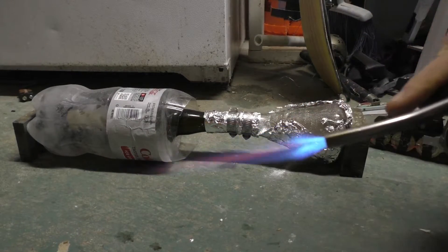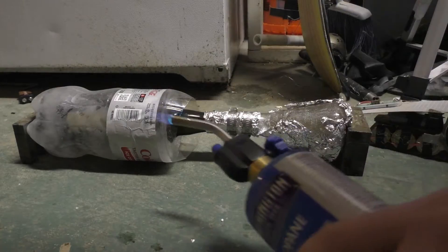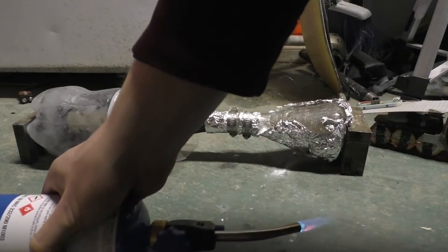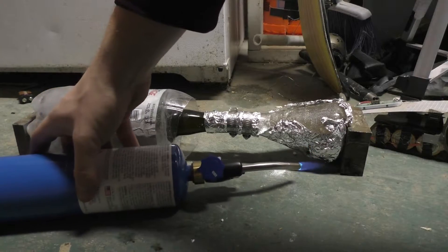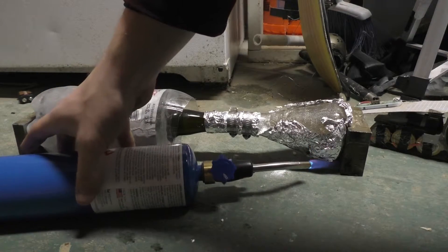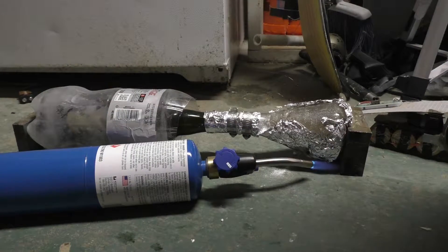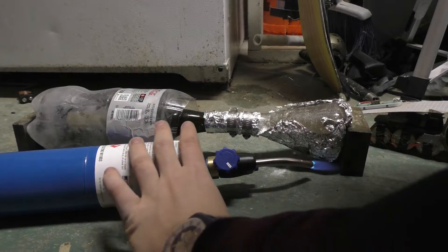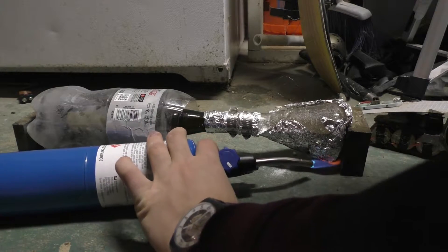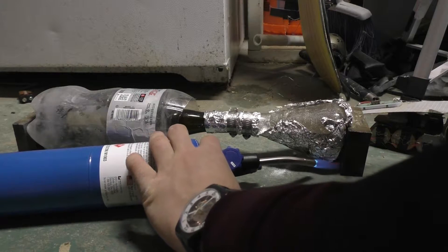In this reaction we're going to use distillation to separate the nitric acid out from the byproducts, which are water and potassium sulfate. You'll need a heat source — I'm using a little propane torch in this video. And you will need a way to collect it after it's condensed. I'm using a beer bottle frozen in a two-liter to condense the nitric acid out of the air. 100% chance of success, zero percent chance of failure — let's go.